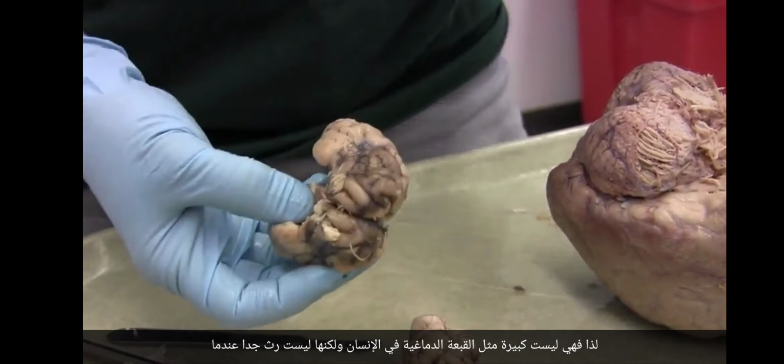And remember this, our friend, our non-neural friend? This is the pineal gland. And you can see that if this pineal gland started to grow, it would start to press down. And right underneath here is part of the ventricular system that could get clogged.